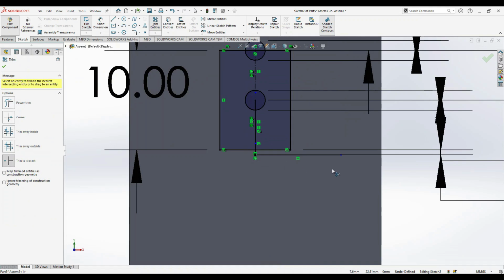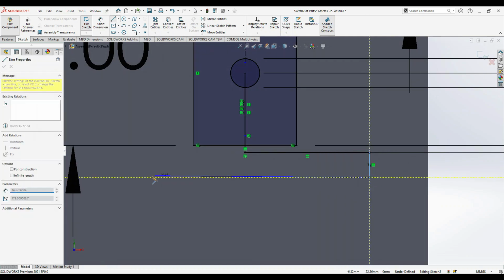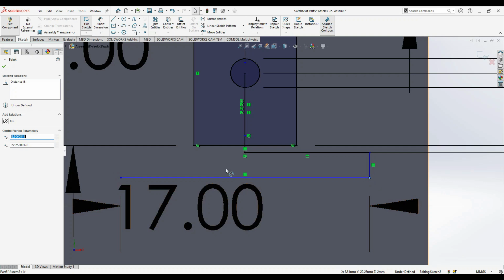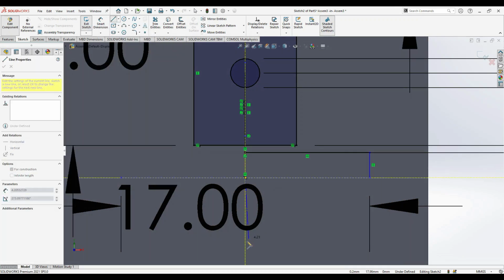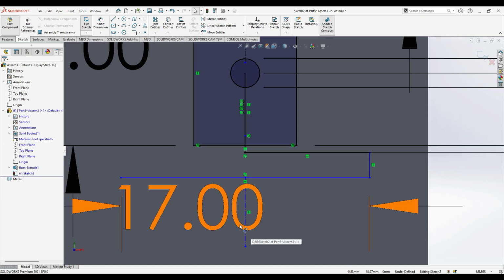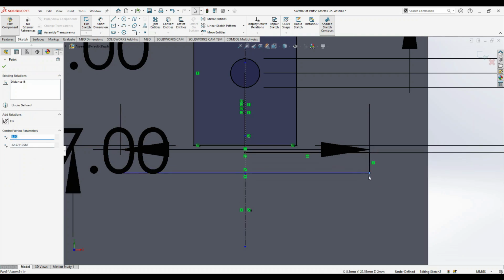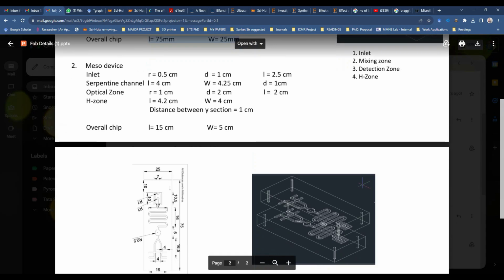Once the 17 mm line is created, you can see the first half is not required and the second half is required. You can just create another line, and this can have a 17 mm length, and we are yet to finalize the width. So this should be exactly half. So you can just constrain this line to be any of the center line and make it collinear. That is this line and this line, make it collinear. Okay, so now you have a center line fixed, and the only thing is you have to give the height, the difference. That we'll see from here, and so that it is given.